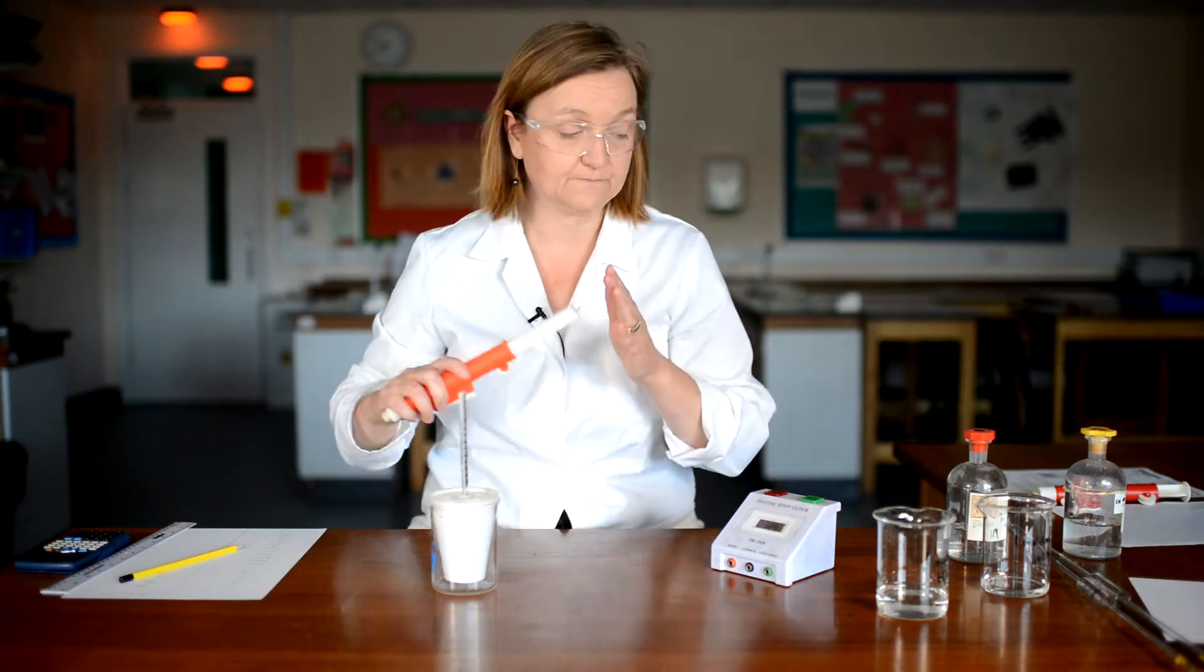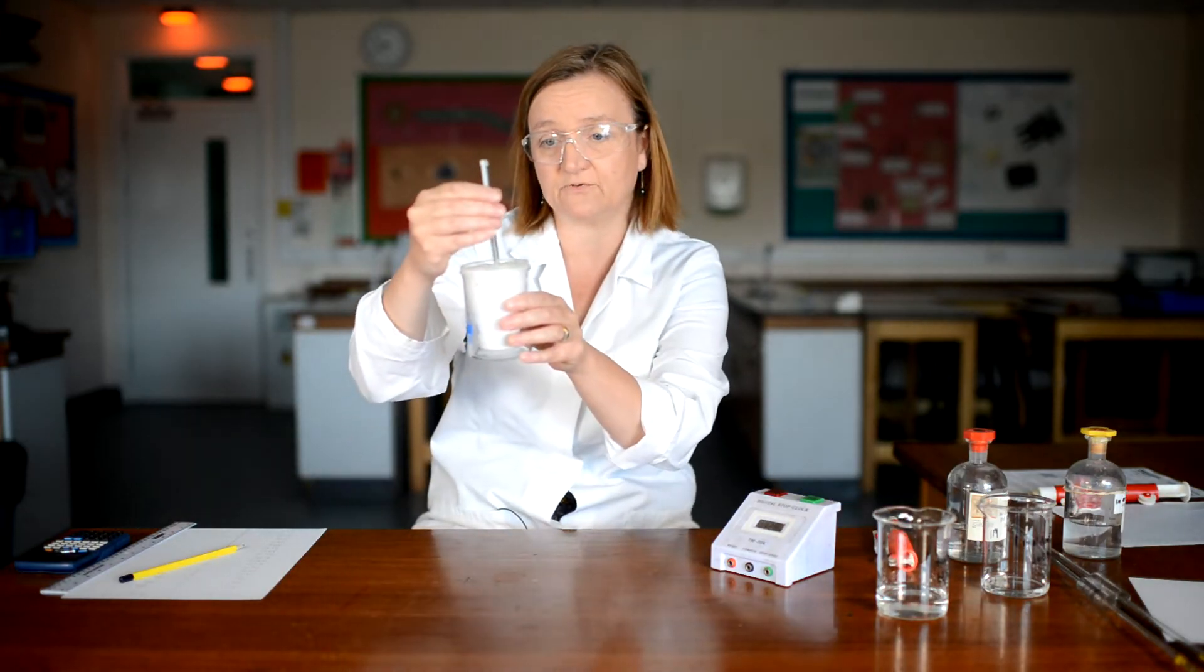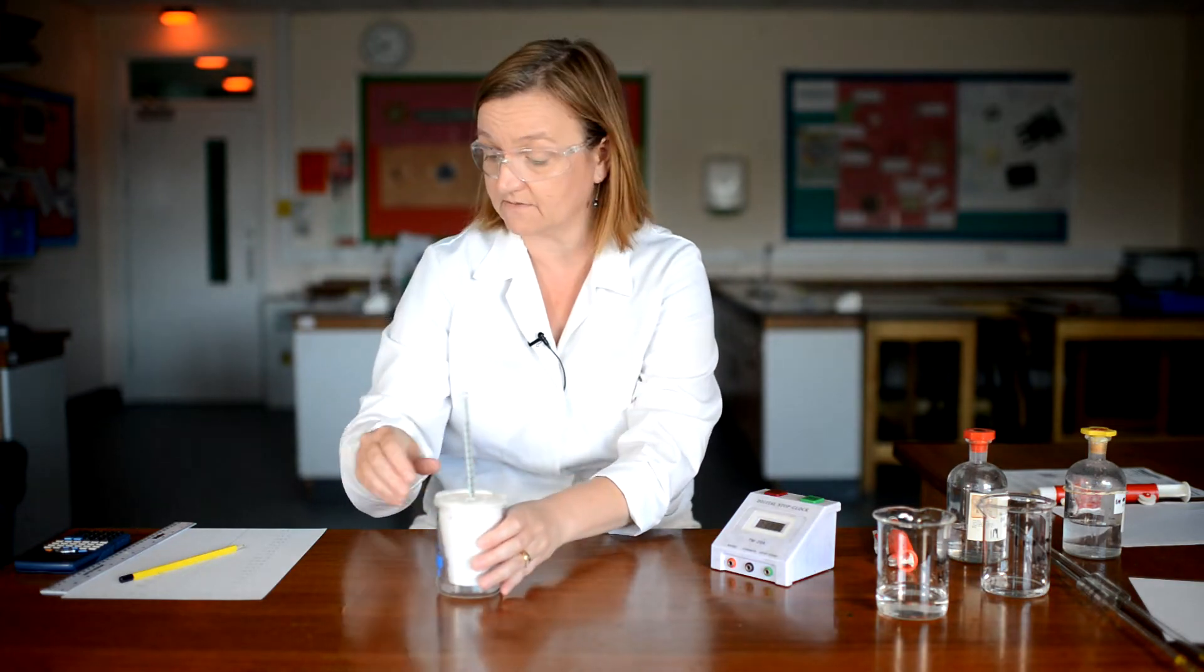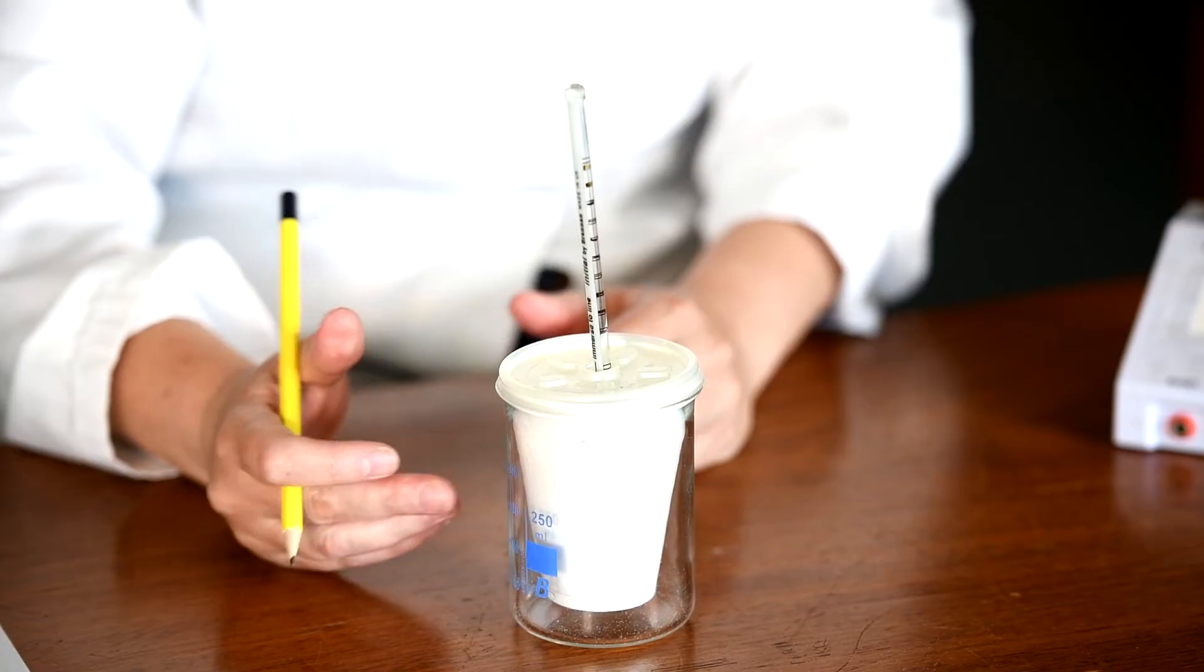Now this is an exothermic reaction. And so I'm expecting the temperature to rise. And so at three and a half minutes, my temperature is now 32 degrees. And I'm going to continue to do this until about nine minutes or so has passed. Now you might think, why are we taking all these temperature readings?